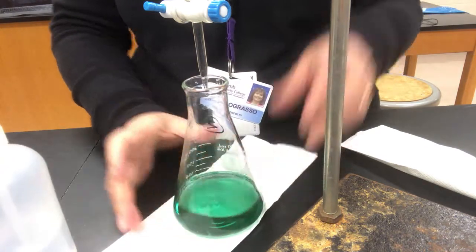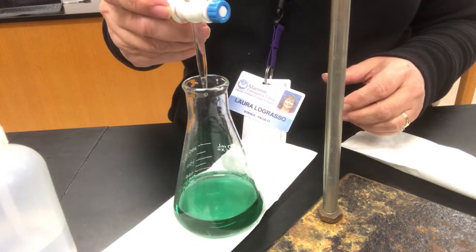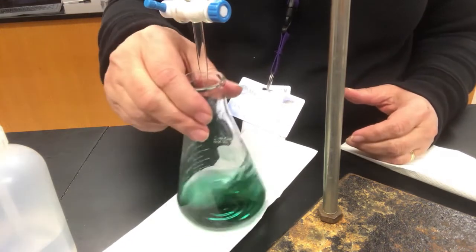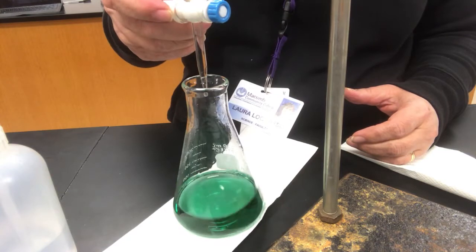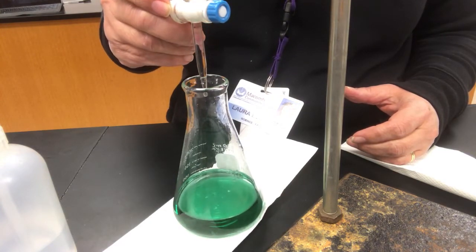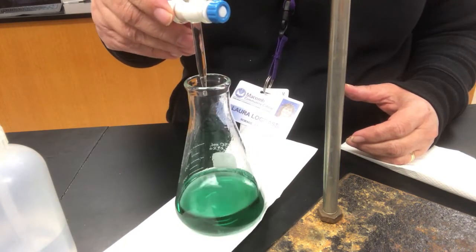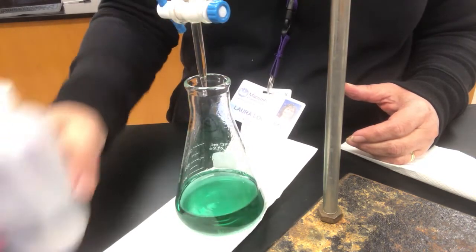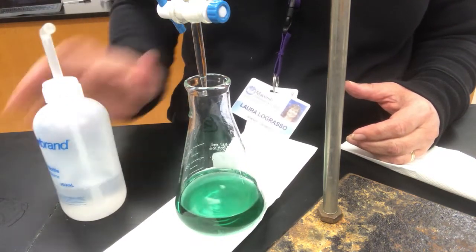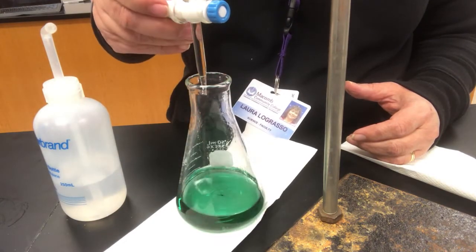Okay, so now I'm going to be careful, and hopefully I'll be able to manage this burette a little better than I did the last time. Wow, already I'm squirting. I should get that other burette back, but I couldn't get any liquid out of the tip, so I'll just grab another one. This one, like I said, is a lot harder to handle. There, I've got a hanging drop now. Maybe now that I'm a little more used to it, I won't have the issues I was having. Alright, let's get some more in there.